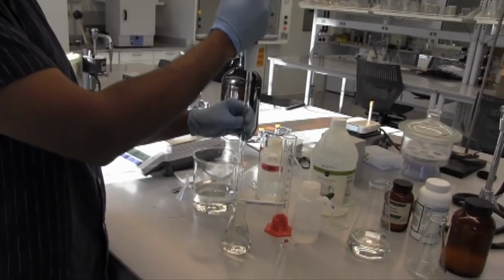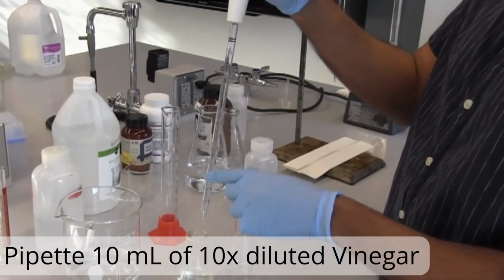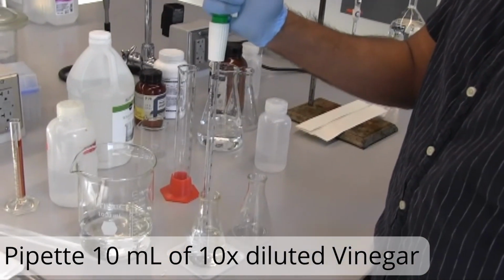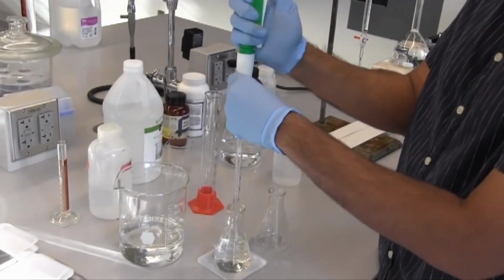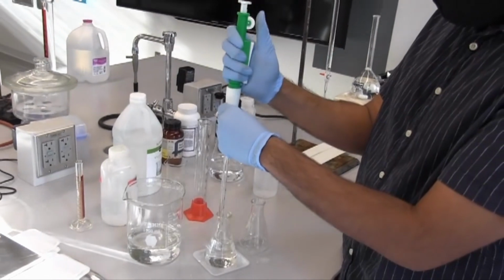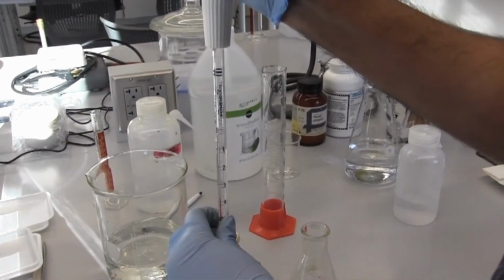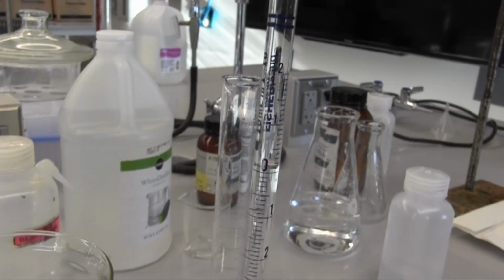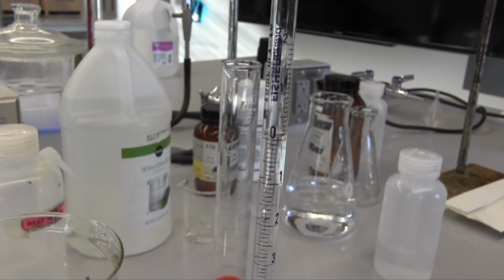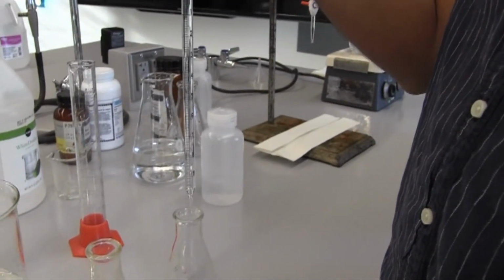Now we'll use a graduated pipette to take 10 milliliters of this now 10 times diluted vinegar, like so. And graduated pipettes are very accurate, which is important. So we get 10 milliliters there, and transfer that into an empty Erlenmeyer flask.